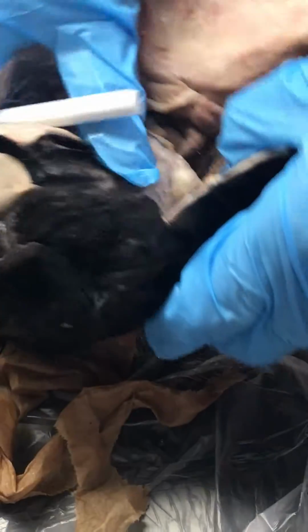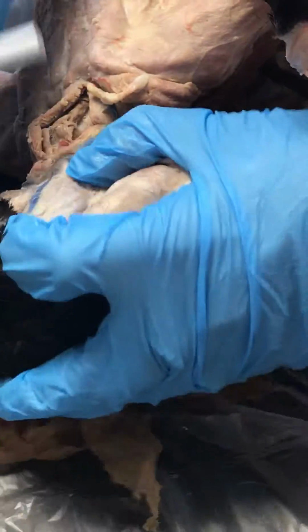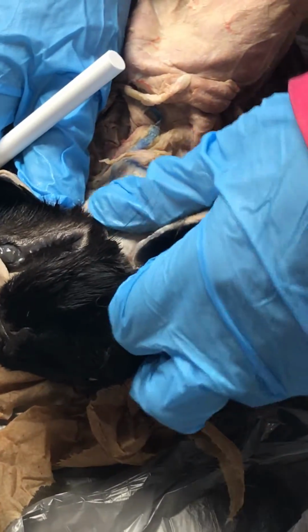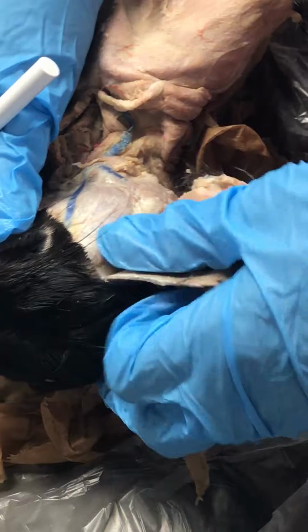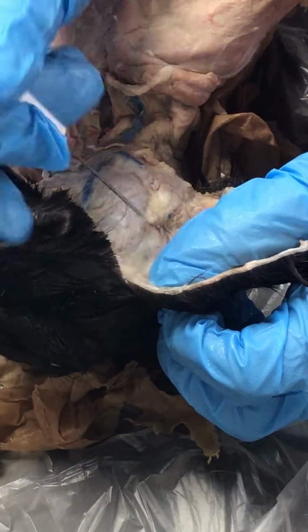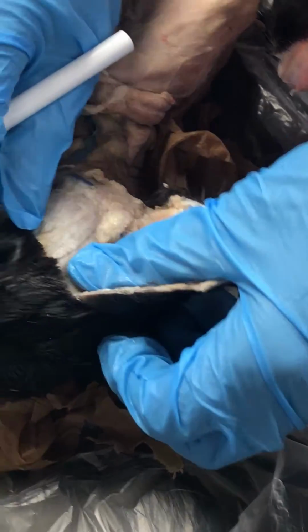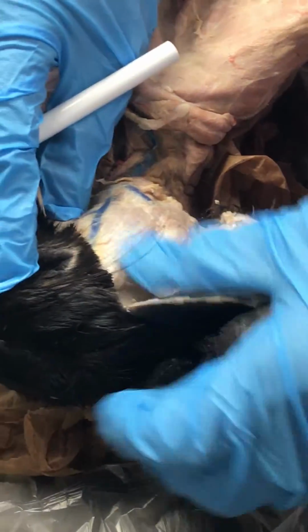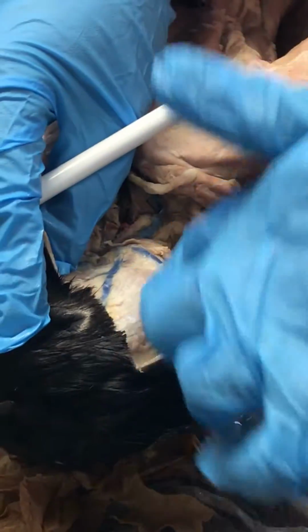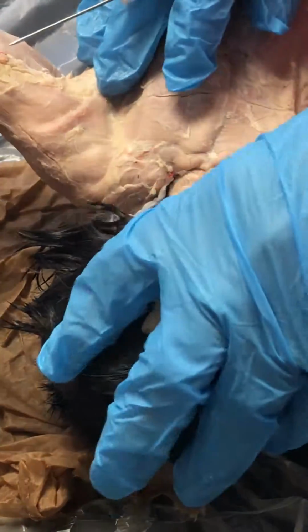Up here, this muscle that has a white sheath, that's all tendon. Right on the jaw is the masseter. It's really on a hard bone because that's going to be the mandible right there. So the masseter's right here, and then the temporalis, if I just have a pin up here above the masseter, that's going to be the temporalis. Again, it's really hard to see because of this white tendon sheath. But masseter on the jawbone, temporalis up here above it. Okay?